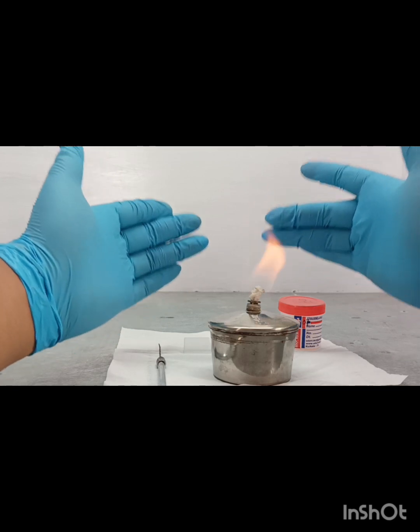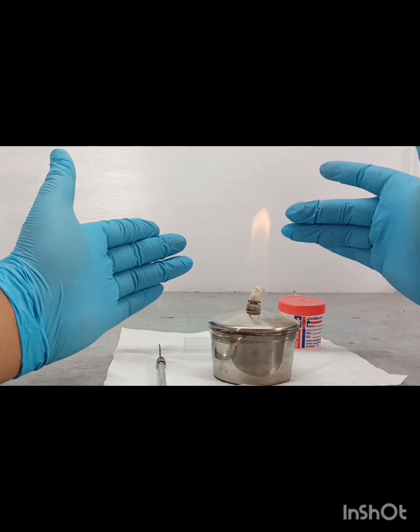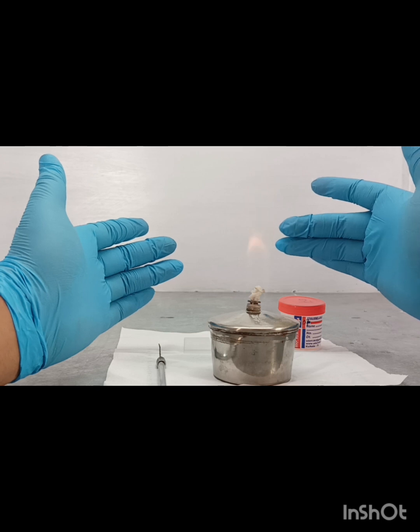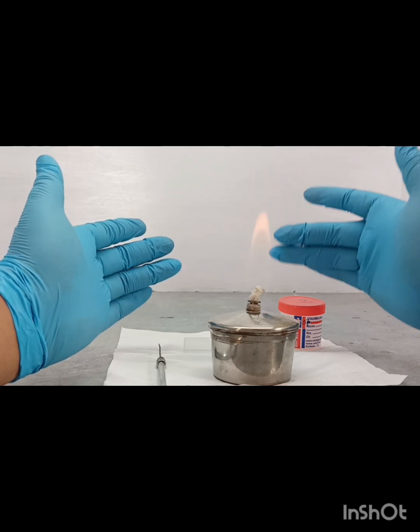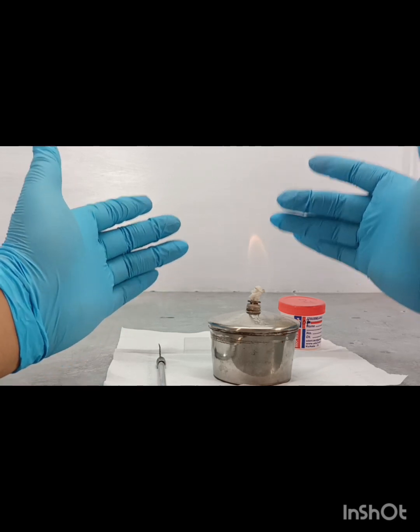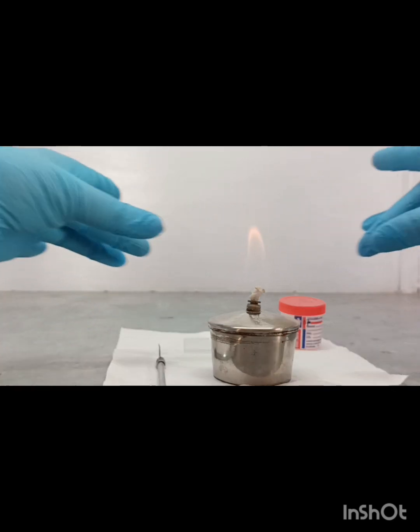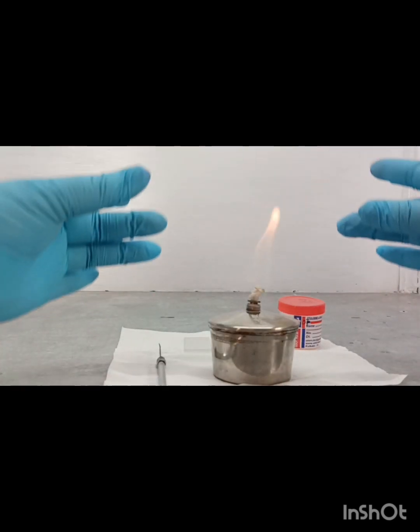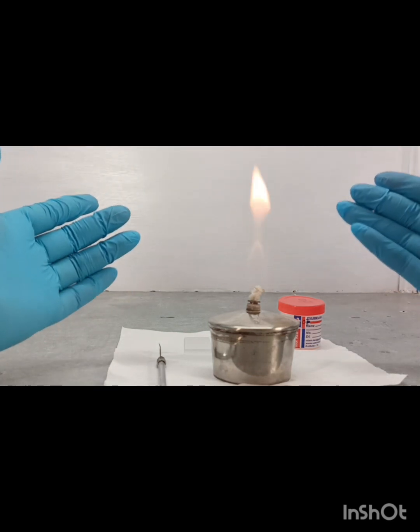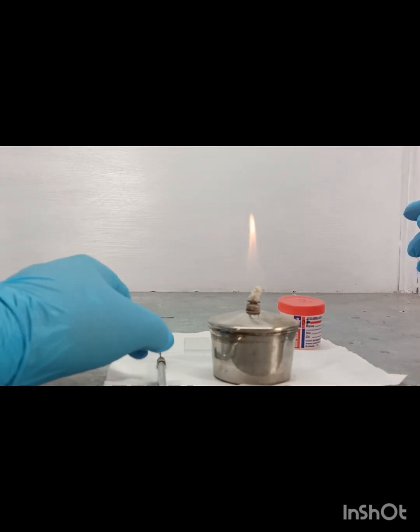Okay, so what is the reason? The reason is that at the time of smear preparation, because of the aerosol nature of Mycobacterium tuberculosis, it should never infect a person nearby. So the flame creates a heat barrier line, which also protects against contamination. You have to be very careful about that.